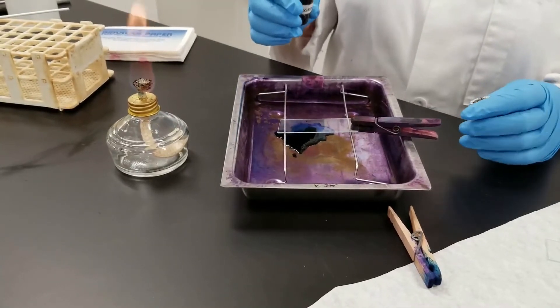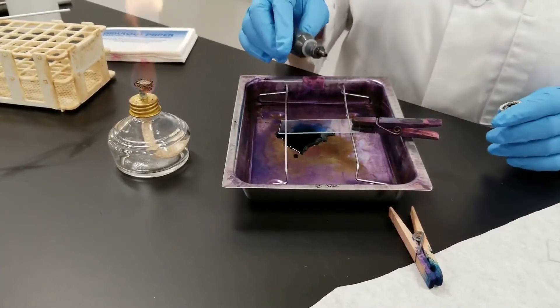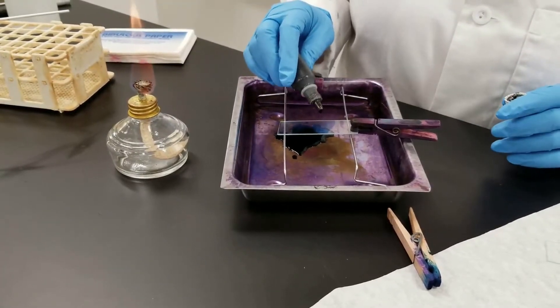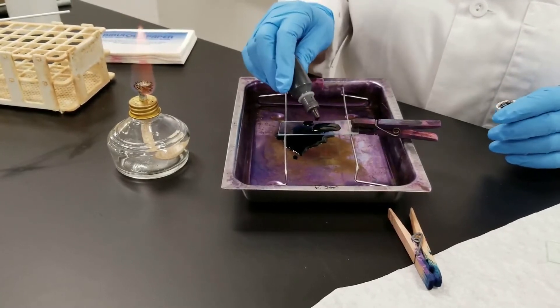If any of you are used to photography, it's like a negative film. So we're just going to put the dye on here, like this.